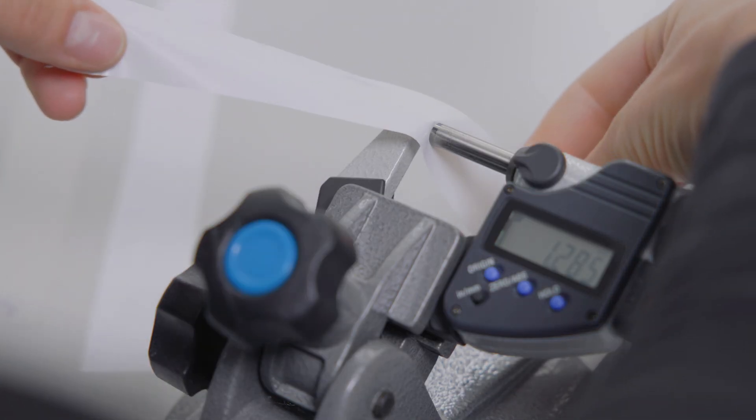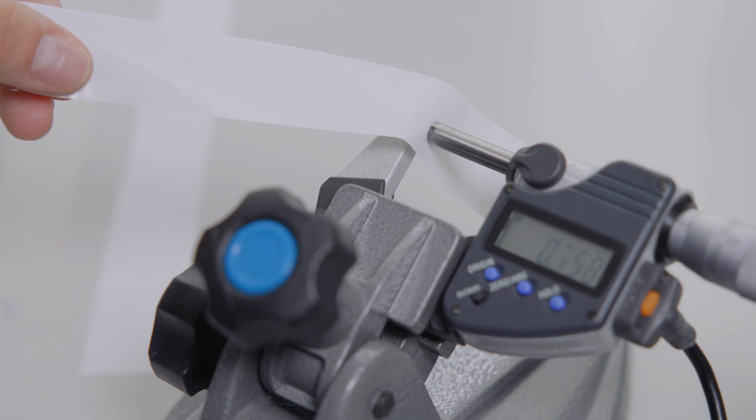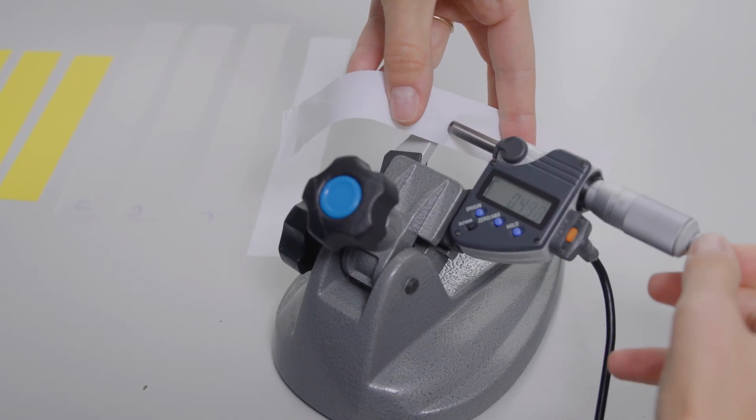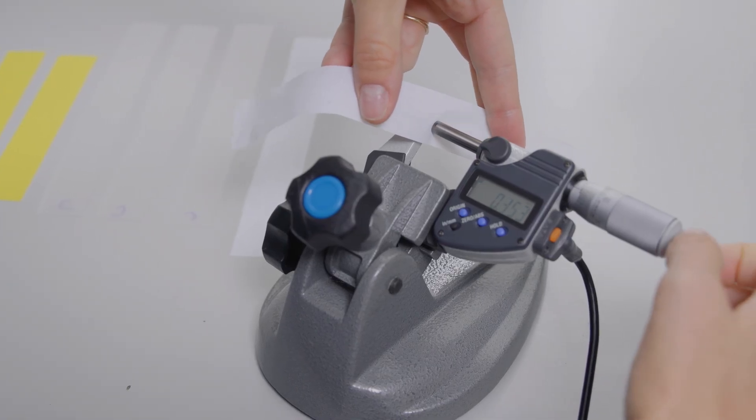Three measurements should be averaged to determine the specimen's width and thickness. A digital micrometer is a suitable option for taking these measurements.